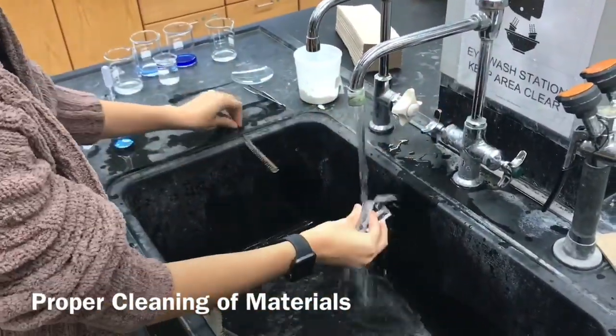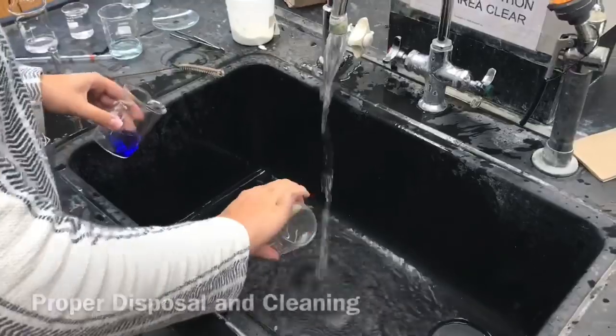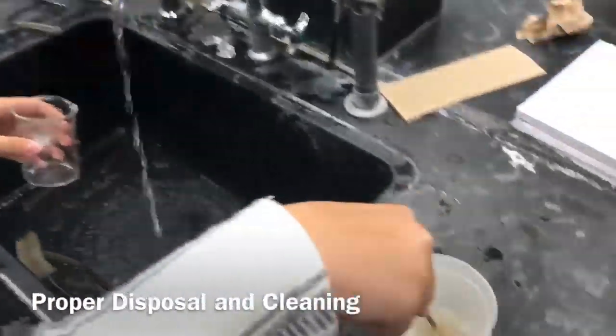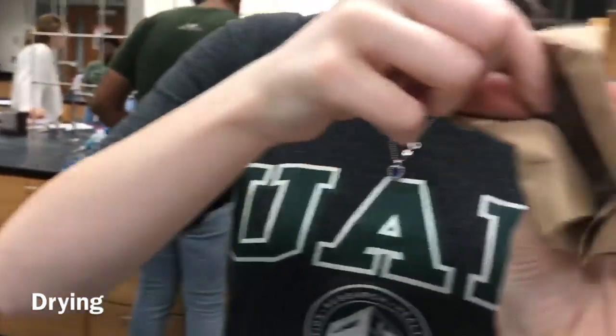Here, Jaime is properly cleaning our materials with soap and water to be used for the next lab group. Here, Rachel is properly disposing of all the liquids used in the lab by pouring them down the sink, and then she cleans the beakers out with soap and water. Here, Morgan is drying the materials used in the lab for the next group.